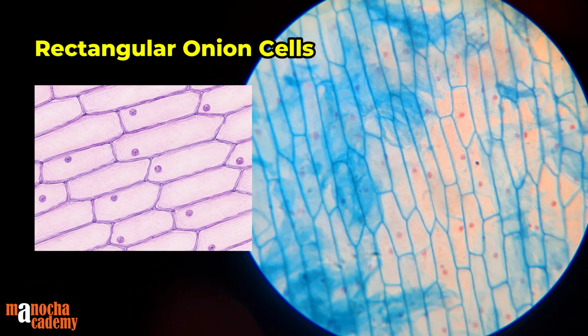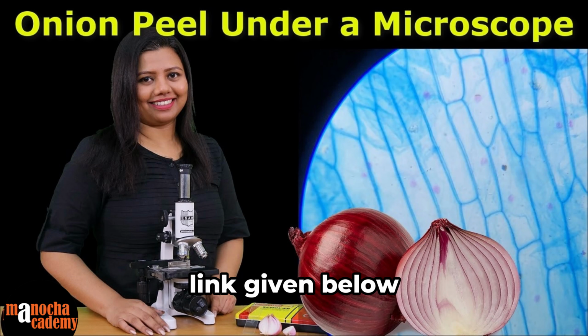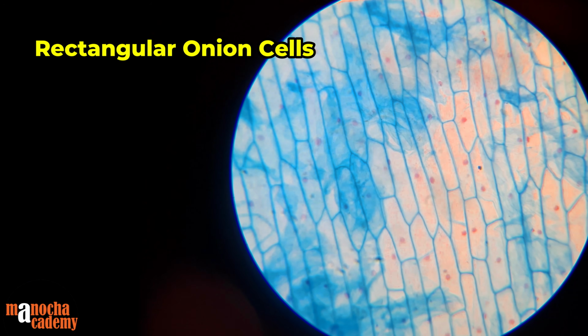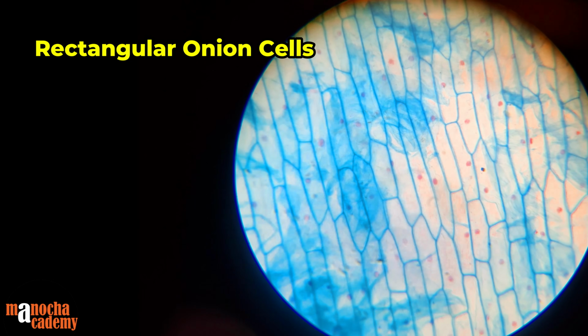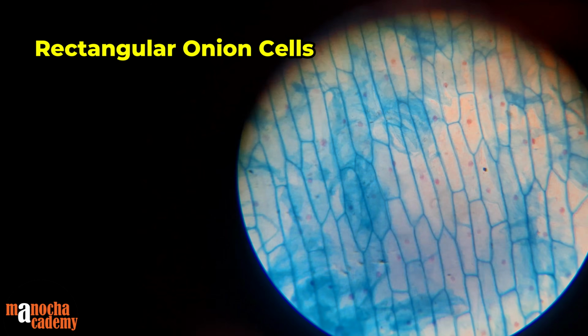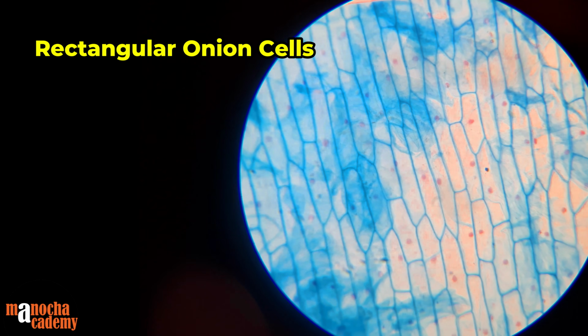The next one is the most common type of cell that we have quite often talked about in our videos on Manocha Academy. In fact, you can refer to the video where we are peeling an onion leaf and looking at it under the microscope, and the video links are given below. So this is an onion cell, and you can see the shape and the structure is very clear, and the cells are rectangular in shape, right? So these are rectangular cells of the onion peel, which we can see in several other plant parts as well.